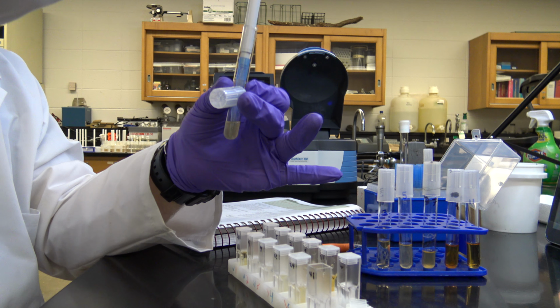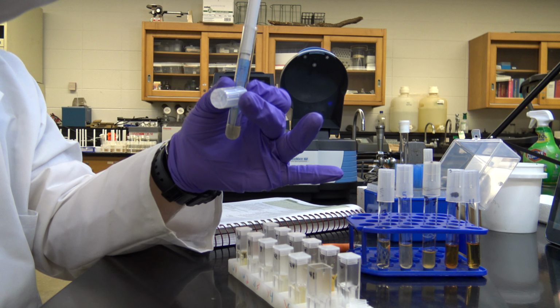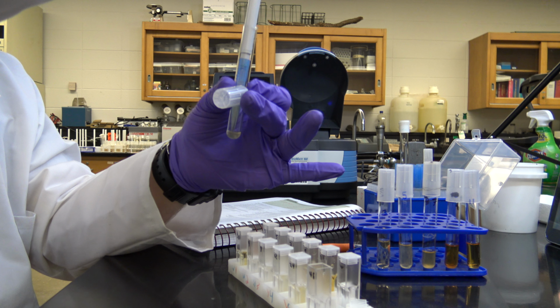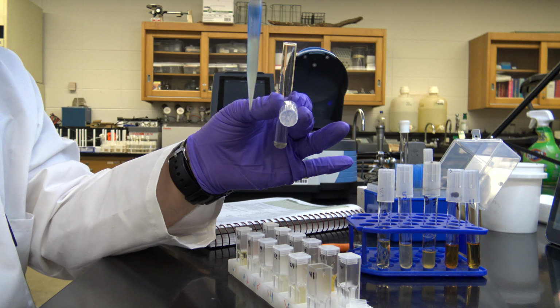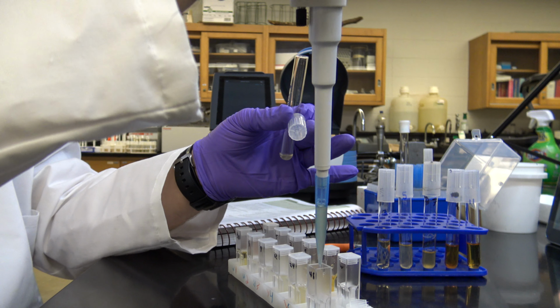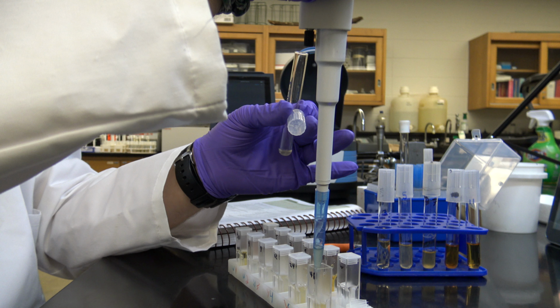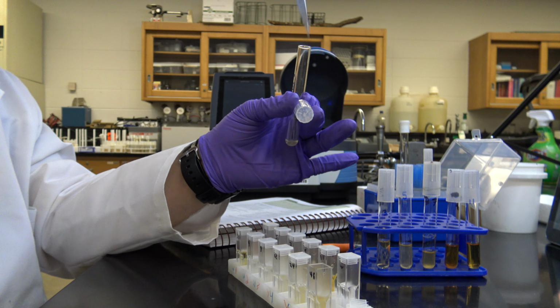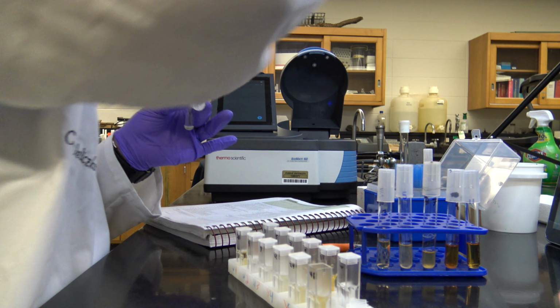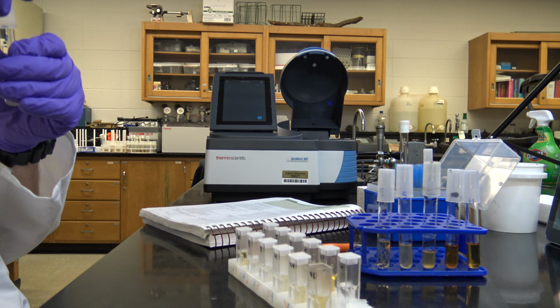And I'm going to slowly pull out. It's important that you do it slowly so it doesn't all splash back up at the pipetter, because then you have to sterilize everything. It's a pain because there's bacteria in here. And then I'm just going to dispense that mil into here, and then dispose of my pipette tip properly.